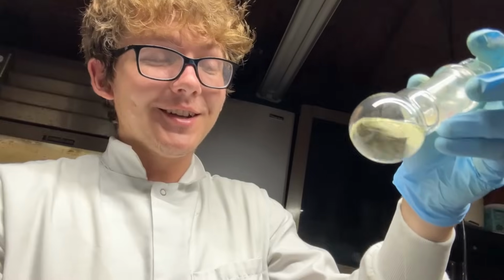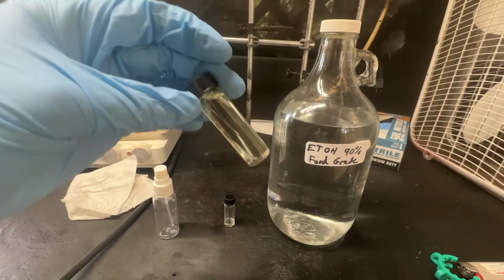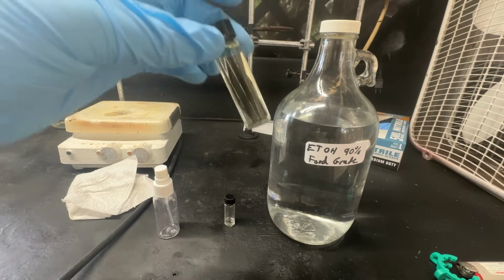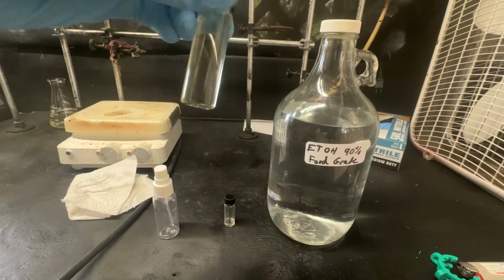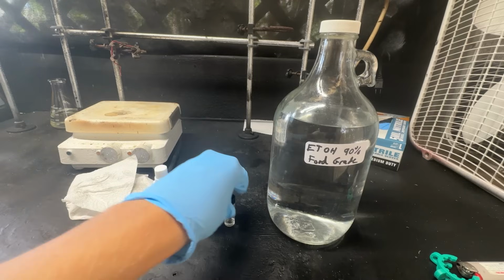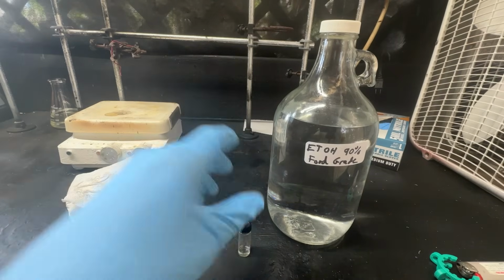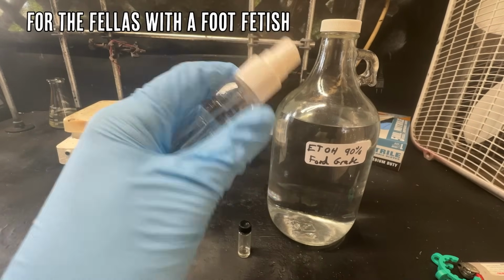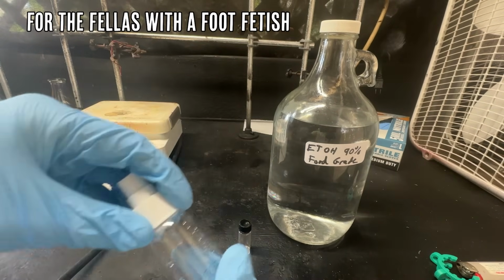Yeah, so there it is. Isovaleric acid, the smell of stinky socks. Okay, so it's the next day here, and we have the smell of stinky feet, and I can still smell it. It's wonderful. We got quite a bit of it here, about 10 milliliters. I think it's the 10 milliliter vial. And then we have a small amount of it here, but we have to do something fun with it. So let's make some cologne out of it. Cologne, perfume, whatever you want to call it.